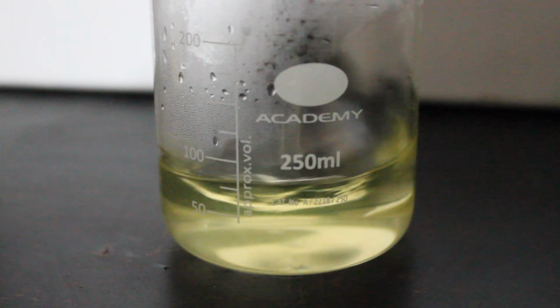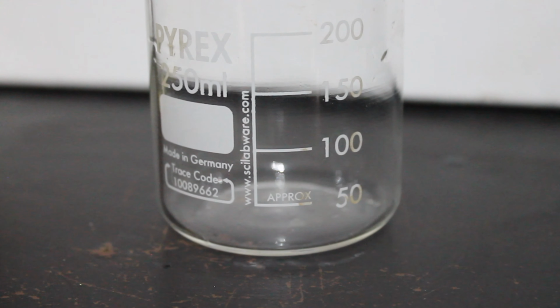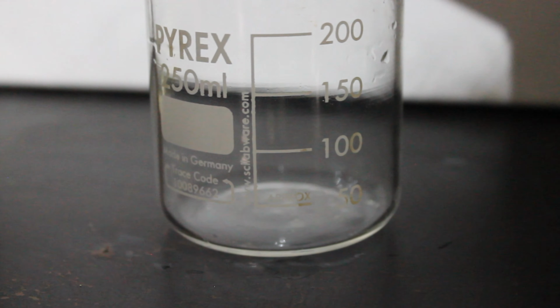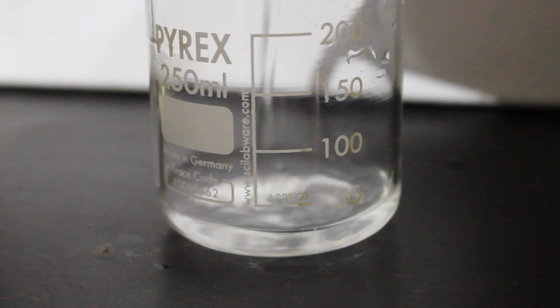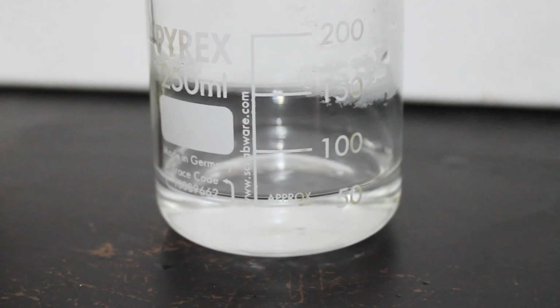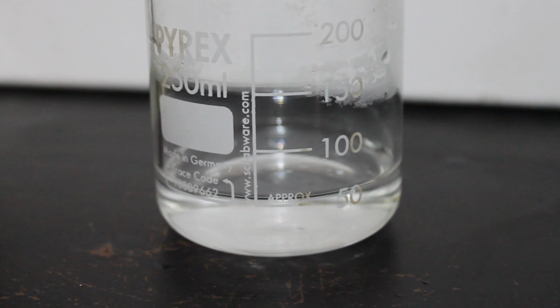But we now prepare Solution C. For this one, we once again begin with 60 milliliters of hot water, and then we add a tablespoon of 3% hydrogen peroxide, and then a teaspoon of starch solution and stir.